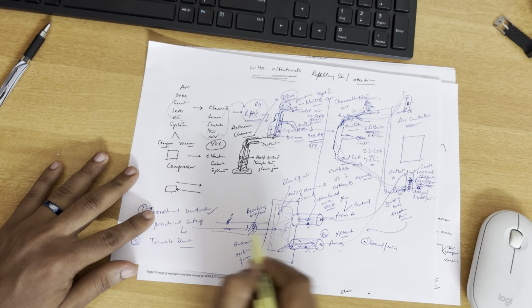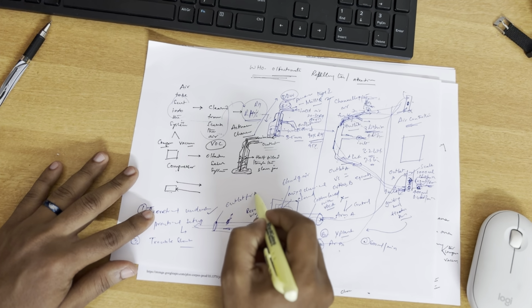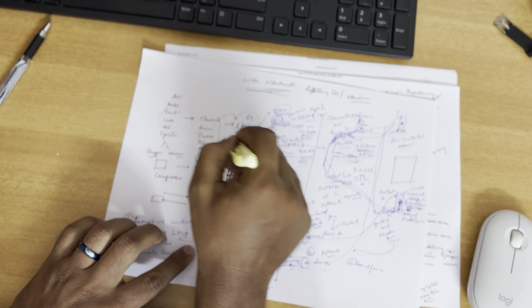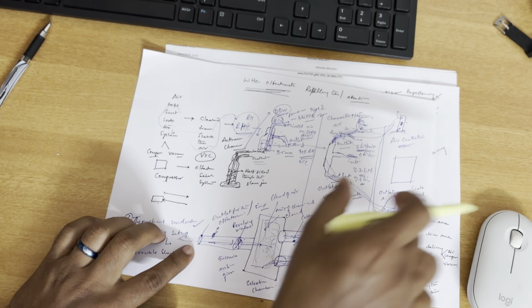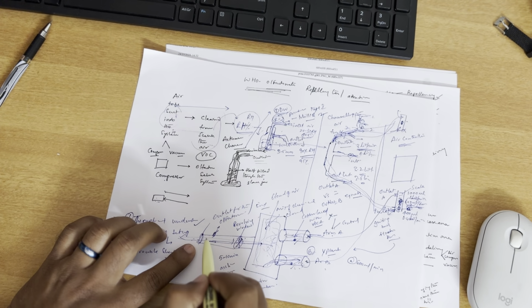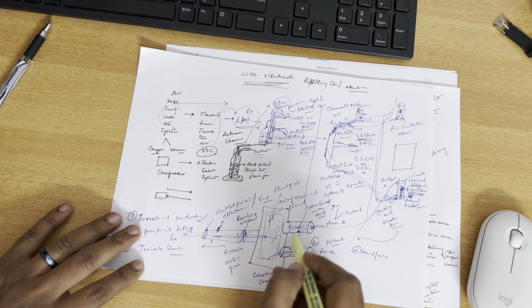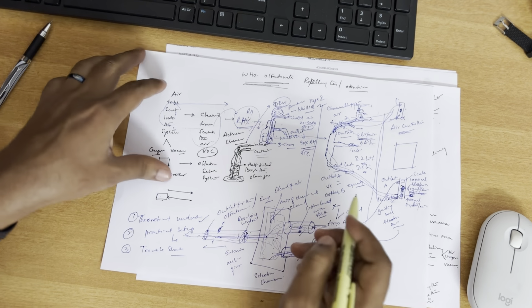The air is trying to go out through the outlet of the olfactometer, or this is the end of the olfactometer. You can think of the air as generated here. Through the airtight system, there are no leakages here, which you have to mind. There is only one place where the air has to come out, and that is this one. So the air is transported all through this way, and then goes out from here. While it is going out, it carries these fumes, the insects actually travel against the fumes, and then they get selected here.